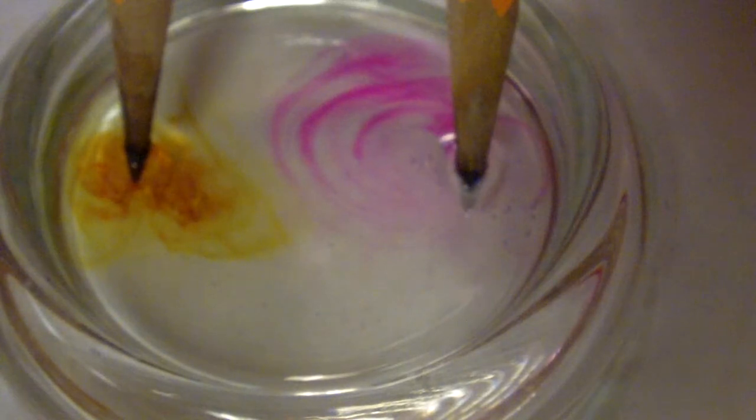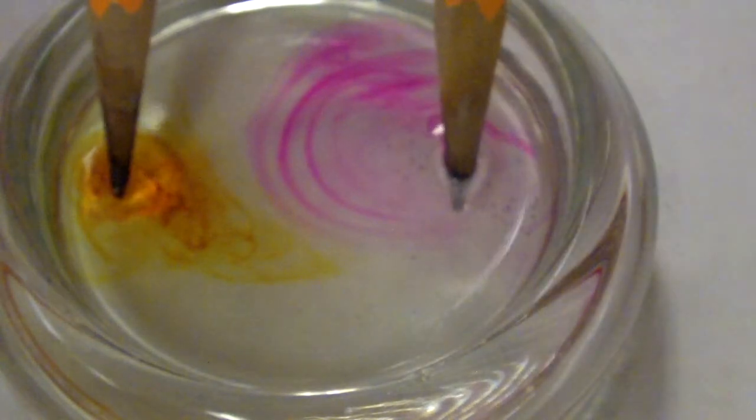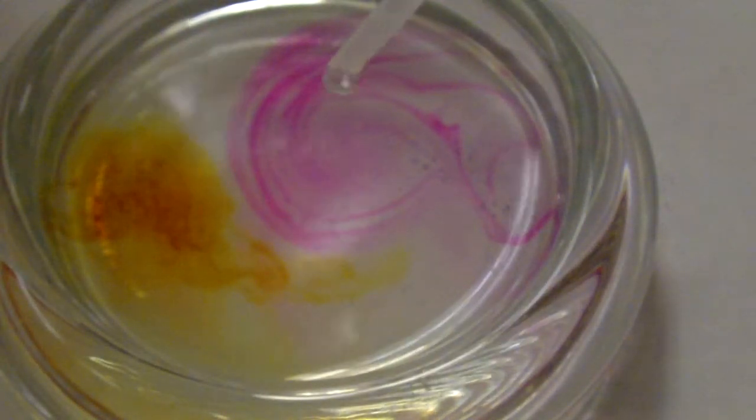Cathode once again on the right side. I'm observing lots of bubbles here on the right side. Oh wow, and it looks like some bubbling is occurring on the left side, so anode bubbling, cathode bubbling. And we have, it looks like, a pink color over on the right side as well, and a brown color over on the left. The pink was unanticipated. There may have been phenolphthalein residue left over in this particular dish. So let's see what happens when we have the phenolphthalein added.